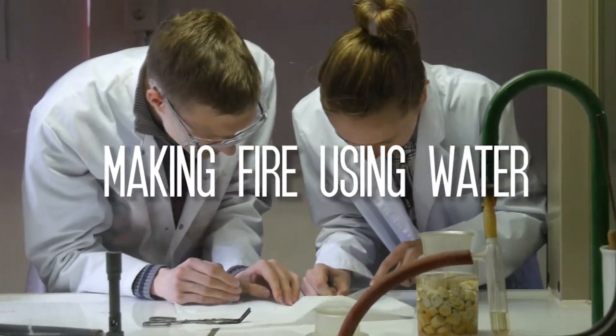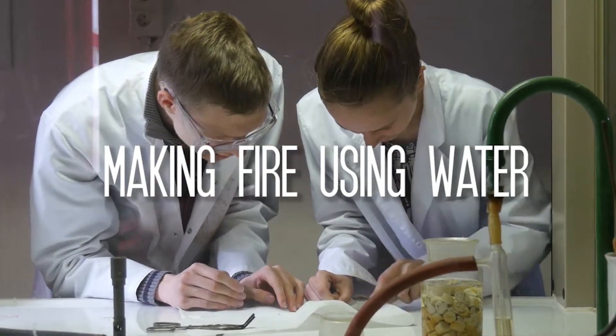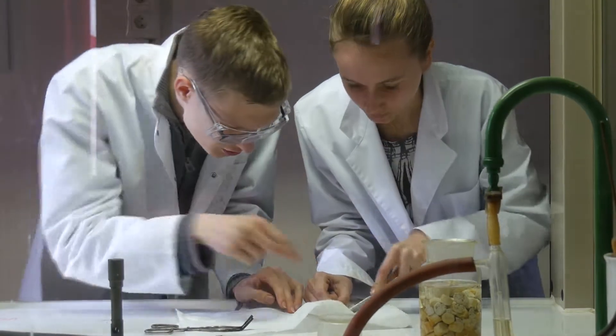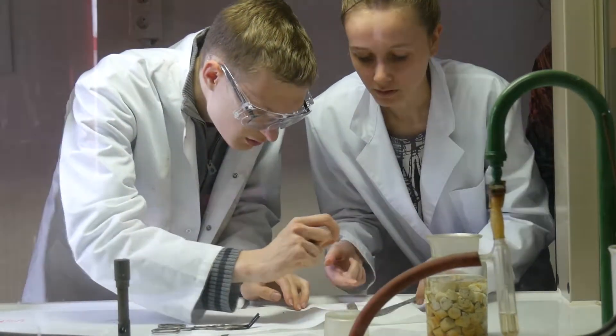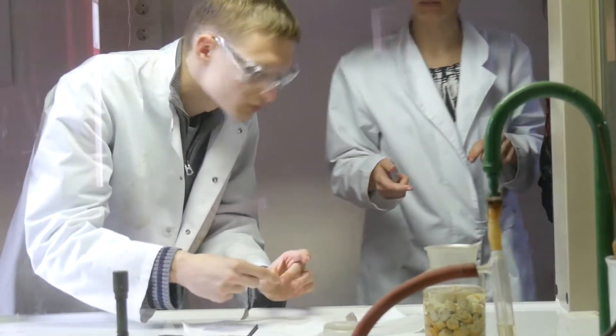Making fire using water. Sounds crazy right? But with a little bit of knowledge of chemistry anything is possible.